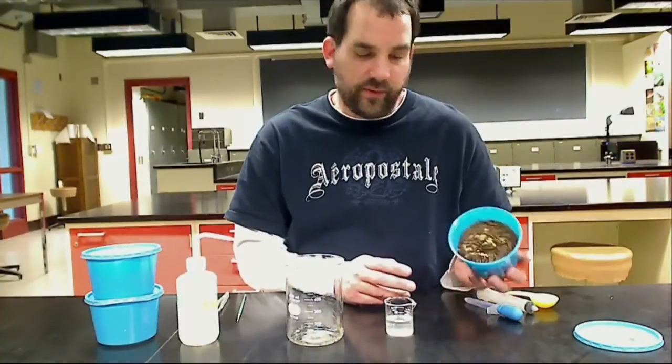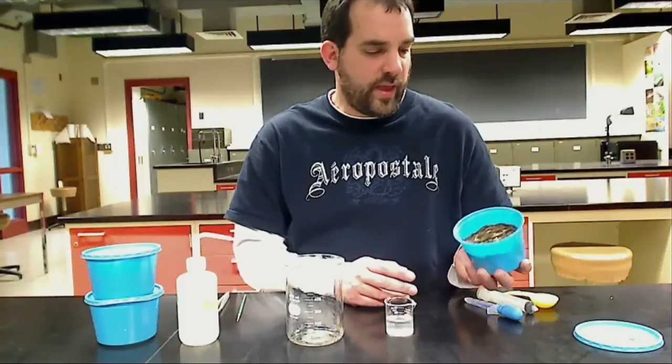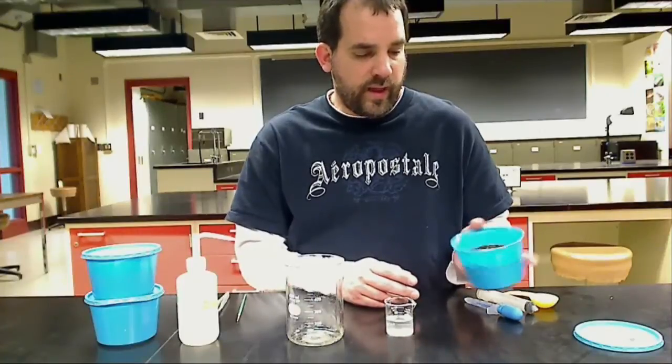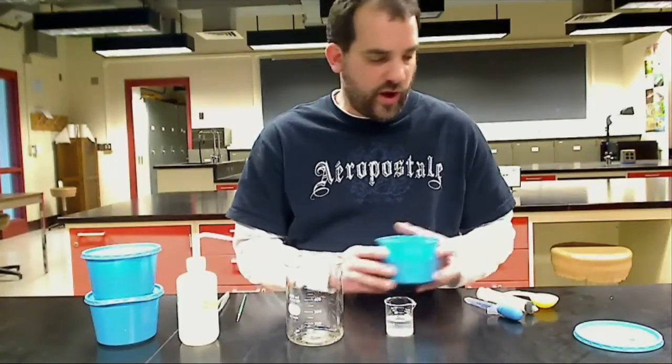Right here I have a cup of infected galleria that I will ship to you when you're ready for your field applications. Today I'm going to use these starter cups.